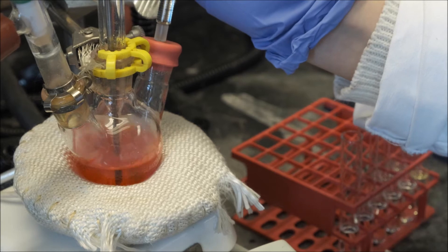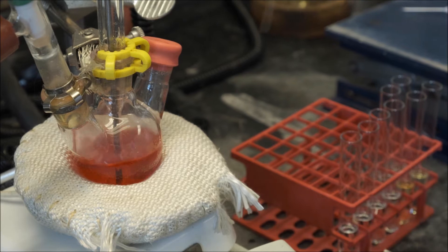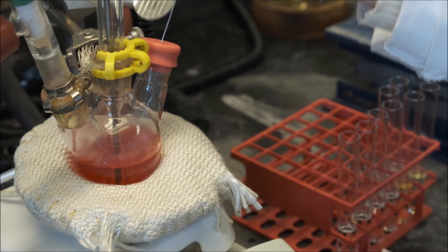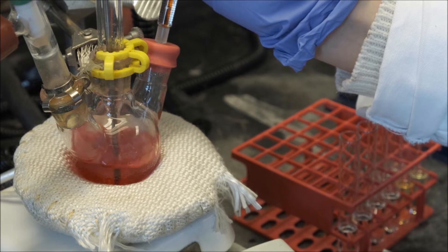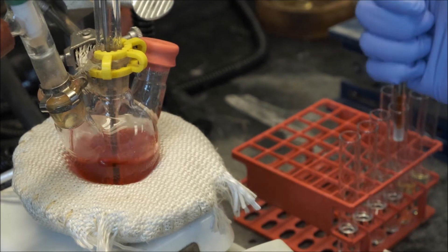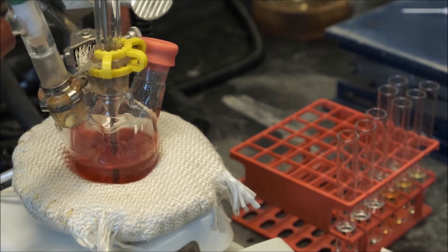In this way, the concentration of monomers is a determining factor in the final size of the nanoparticles. The entire synthesis for cadmium selenide is quite rapid. In this setup, it takes about 5 minutes to go to completion, or can be stopped earlier to obtain smaller nanoparticles.